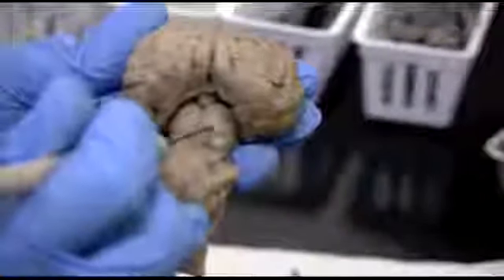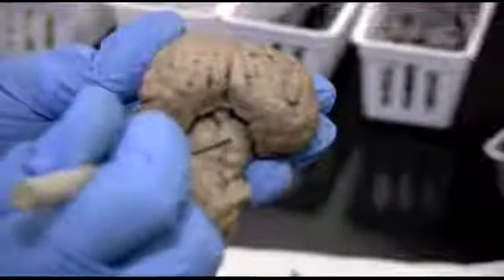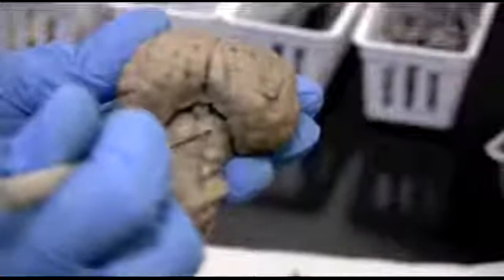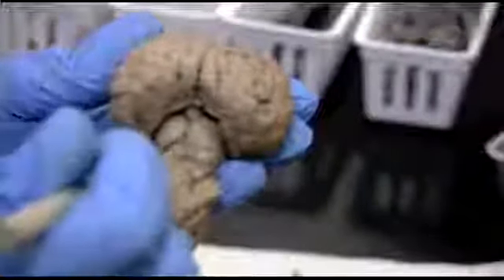These are the superior colliculi, and below it would be the inferior colliculi. So 2 pairs of colliculi together, those 4 bumps make up the corpora quadrigemina. And that's one of the main portions of the midbrain, or mesencephalon. It's on the posterior side. You actually have to pull back the cerebellum.